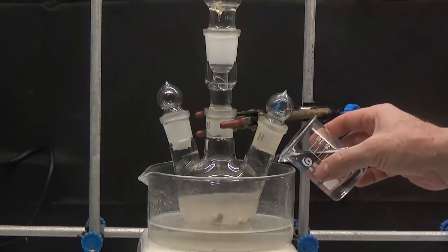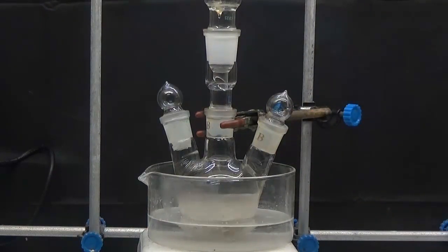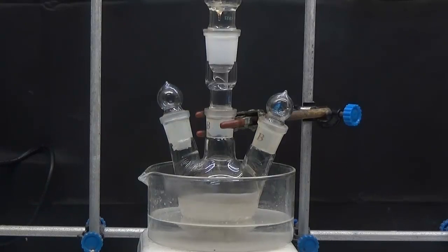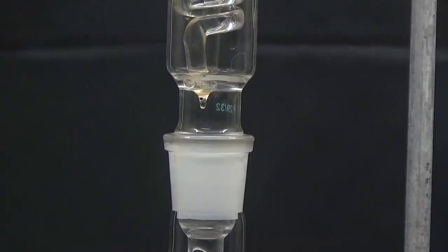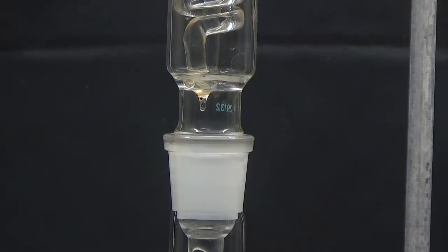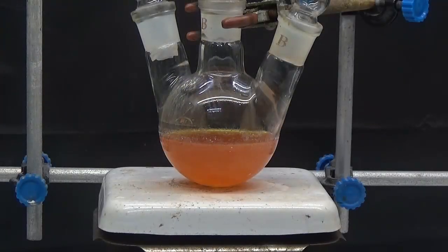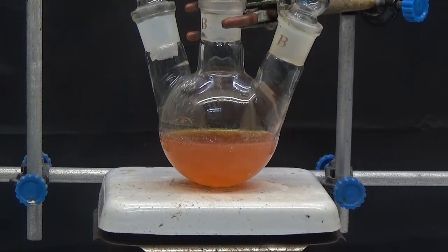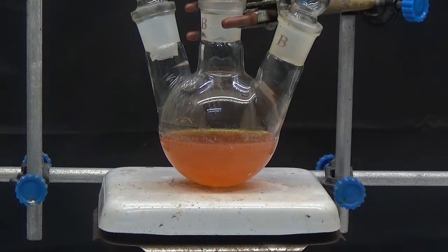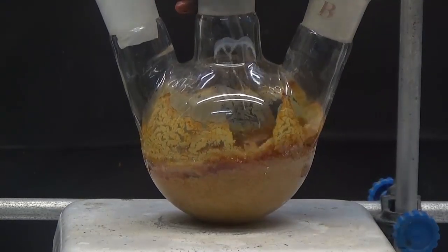Heat with a water bath, and if the reaction becomes violent and strong reflux is observed, add cold water to soften the reaction. When all sodium has dissolved, keep a light reflux for 2-3 hours. After this time, the contents of the flask have an orange color. When cold, a precipitate is observed.